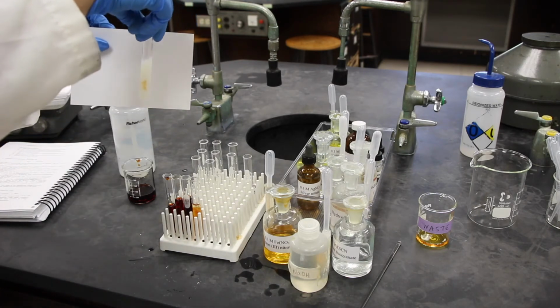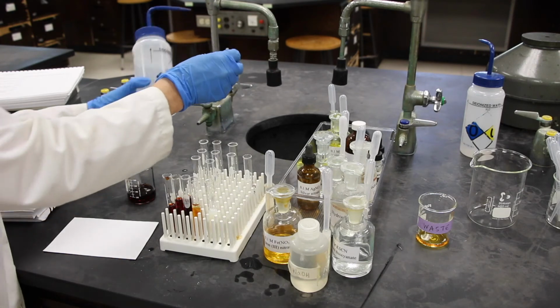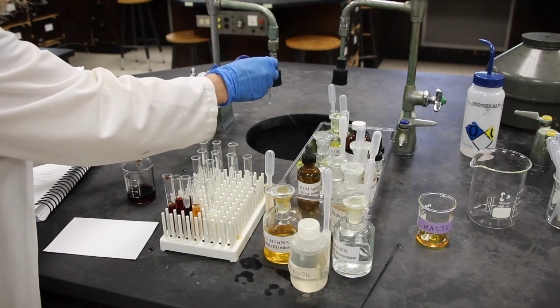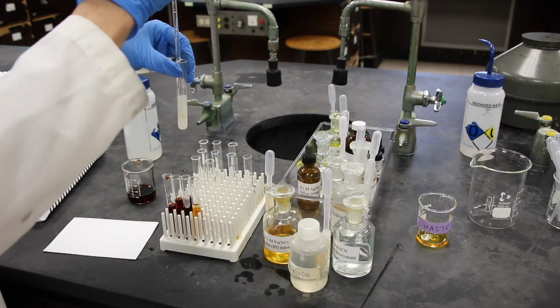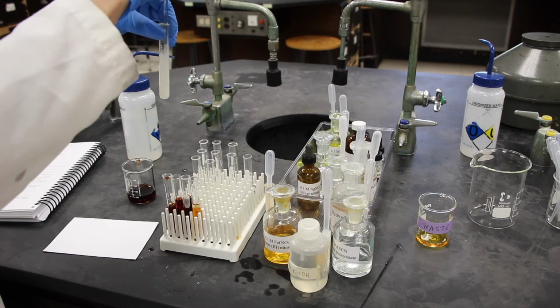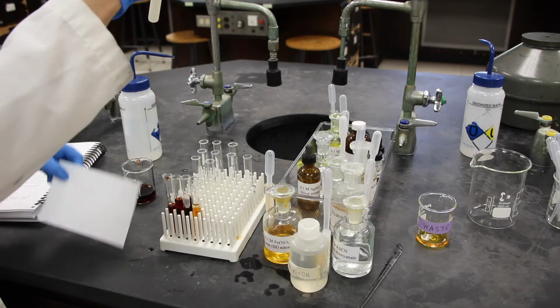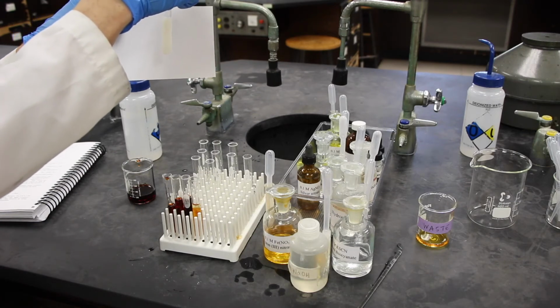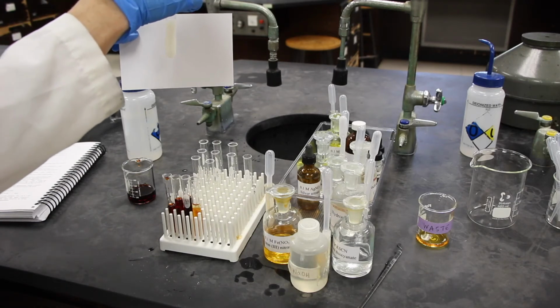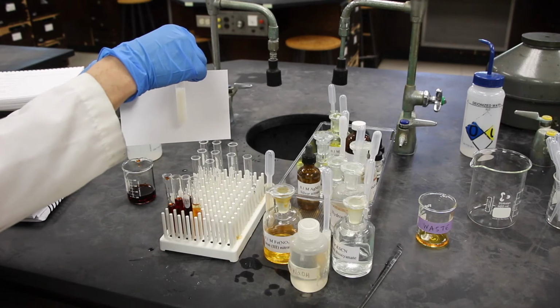Let's look at the color here. I'm going to use my stirring rod. I used this last in part B, so I'm going to give it a rinse with DI water. Now, let's look at this. One of the big questions I get is, I don't know what color this is. Well, is it closer to yellow or red? And I'd like you to pick that. That will help you determine the shift of equilibrium.